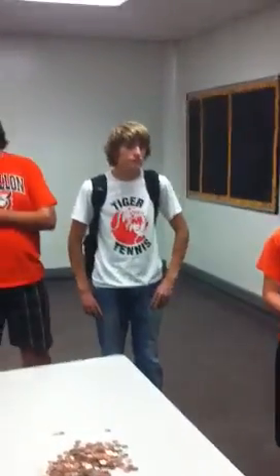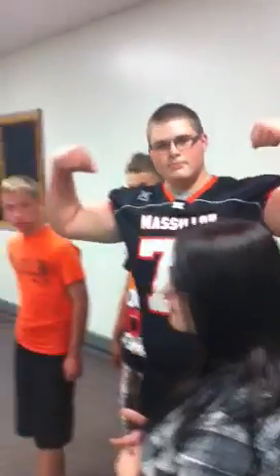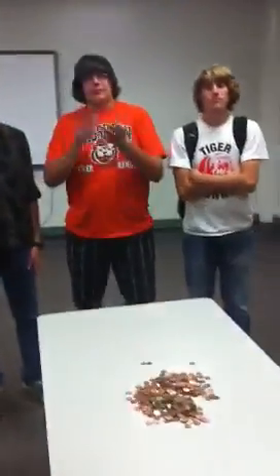All right, so we're starting with the Penny Enzyme Lab Reproduction. This is not actually an actual class doing it. These are folks who have come in extra after school to dedicate their time to get this recorded for us. Thank you very much, ladies and gentlemen.